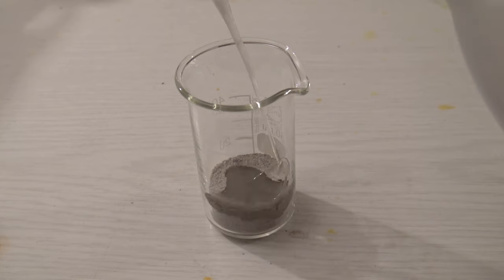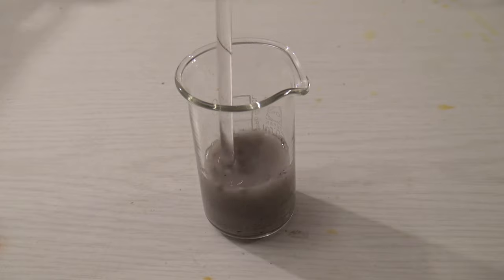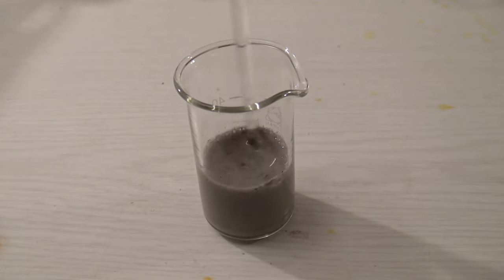At first, some ash was mixed with water and stirred. This causes some of the components to dissolve, then it was left to sit until the insoluble part sank to the bottom.